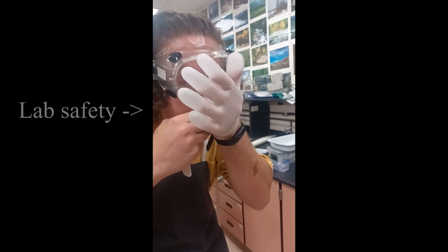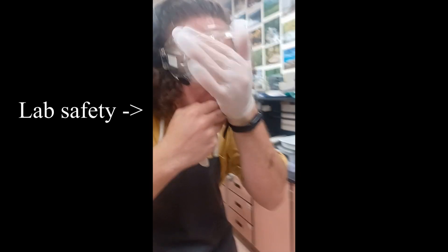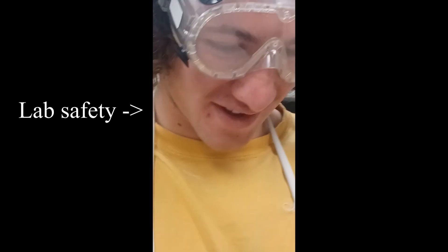Cadaverine is the primary component responsible for the odor of decomposing tissue. It is formed when the chemical lysine is broken down.